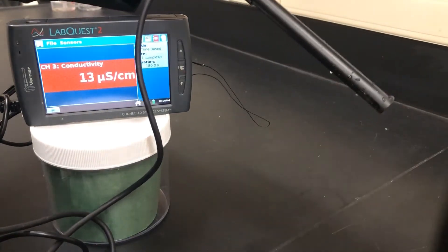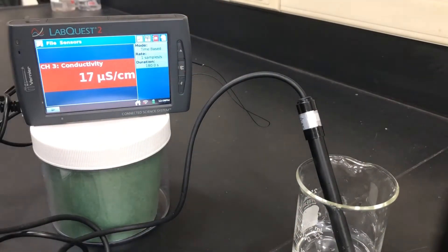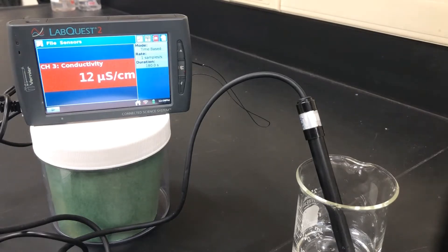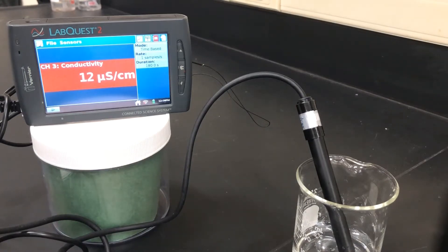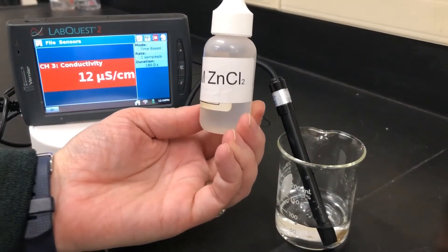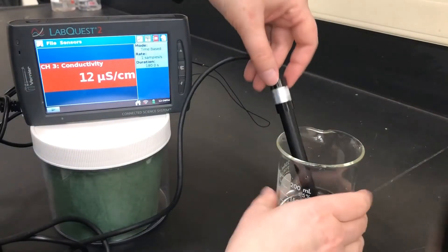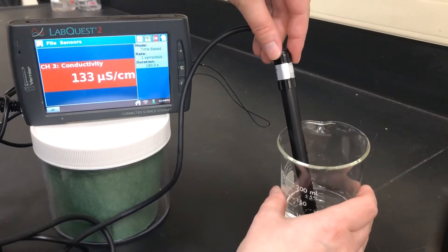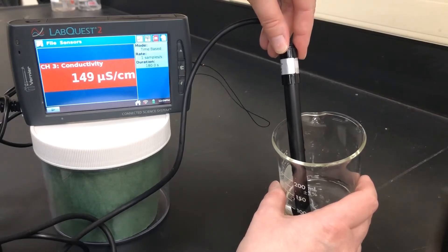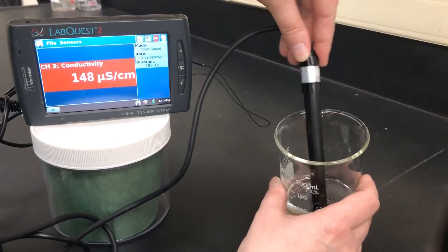For the next test we've got our fresh beaker of 70 milliliters of DI water. We're going to record the initial conductivity for zero drops. Zero drops for our second trial of zinc 2 chloride — we have 12, so please record that. We're going to do the same procedure as before, one drop at a time, using one molar zinc chloride. 148 for one drop of zinc chloride.